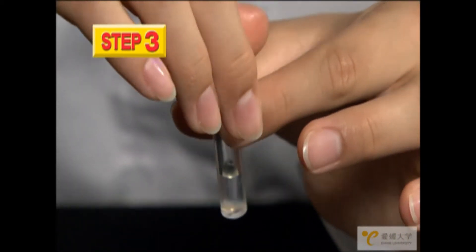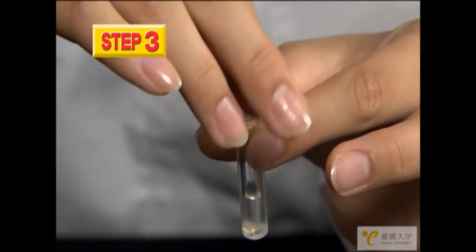Put the tube back in the rack and put on the cap. This is the control sample.